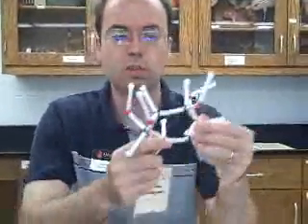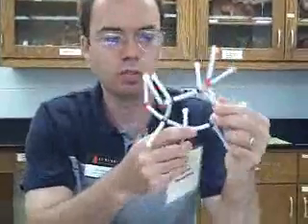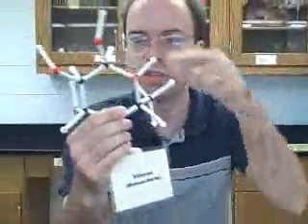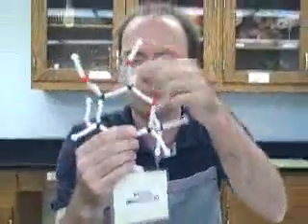The first thing we tested was carbohydrates. Carbohydrates are just sugars, and there are three main types. Monosaccharides are simple sugars composed of only one sugar ring, like glucose here — you can see it has only one ring.